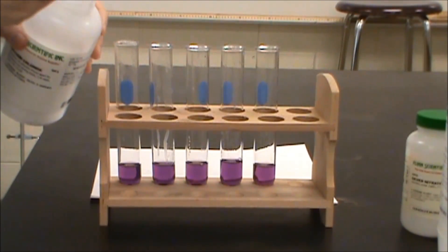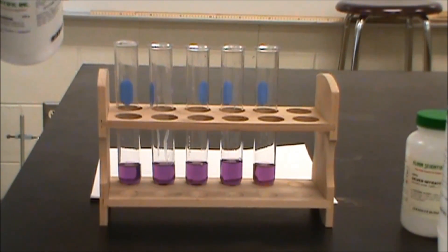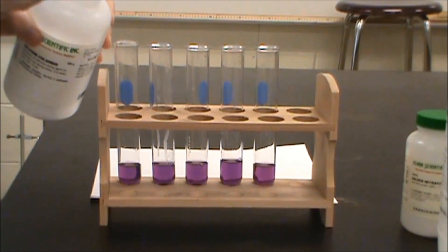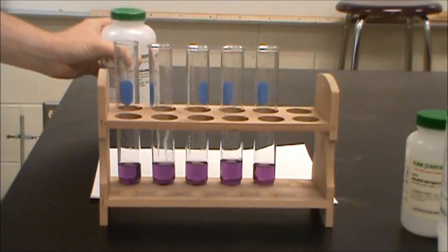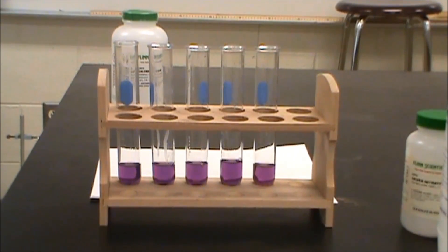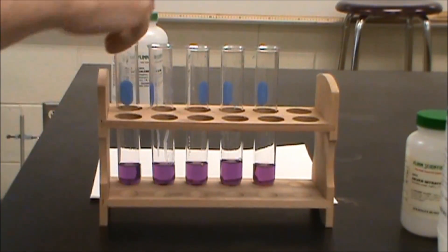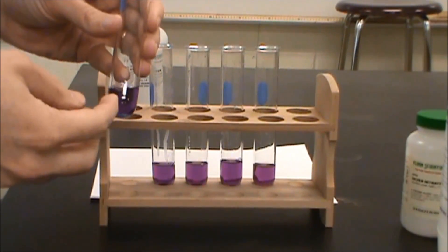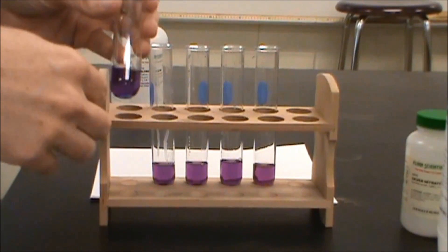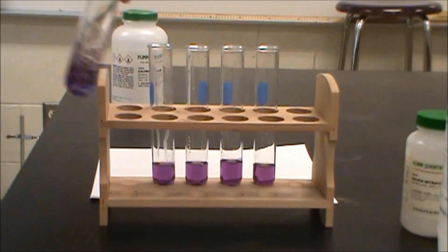In our first test tube here I'm going to put some calcium chloride in there. That's a source of chloride ions. That's going to cause an increase in the chloride concentration which is going to cause a decrease in Q. It's going to speed up my forward reaction and so I'm going to build up more product which in this case involves the blue cobalt chloride complex. So as this mixes you're going to see this kind of go through the purple and then it's going to go to blue, especially at the bottom there. Now it's going to take some time for that to dissolve.